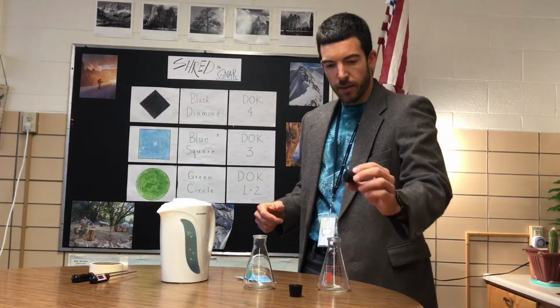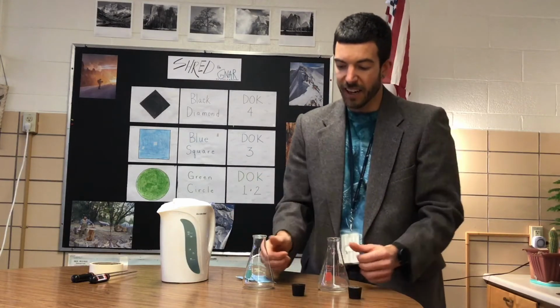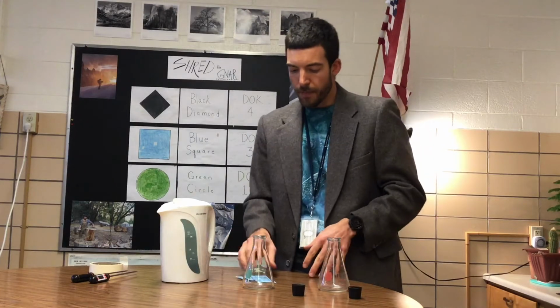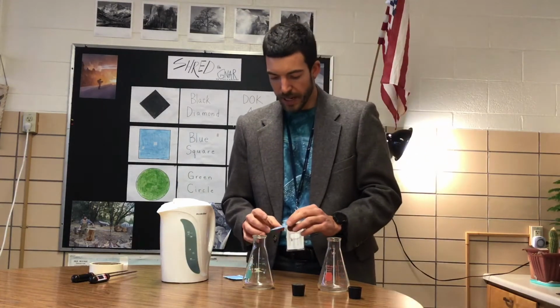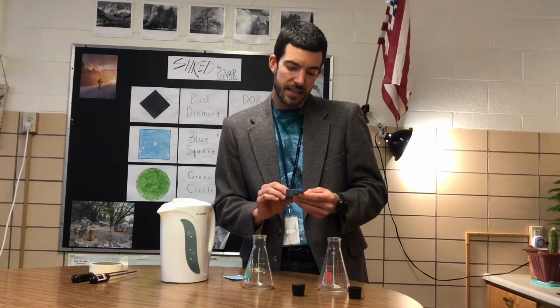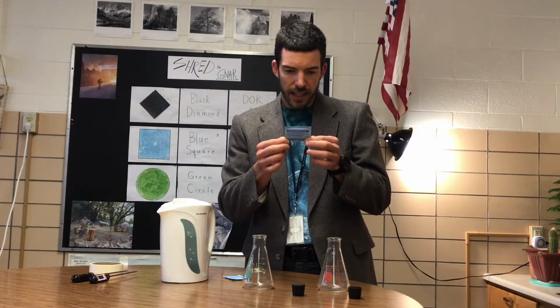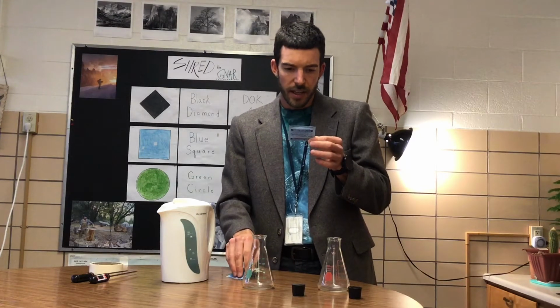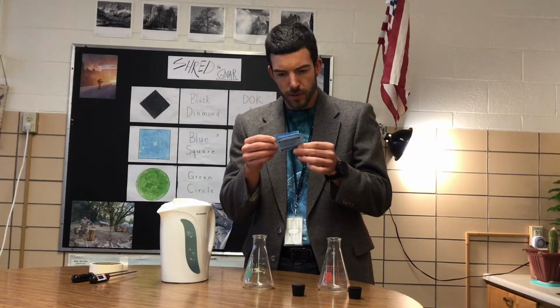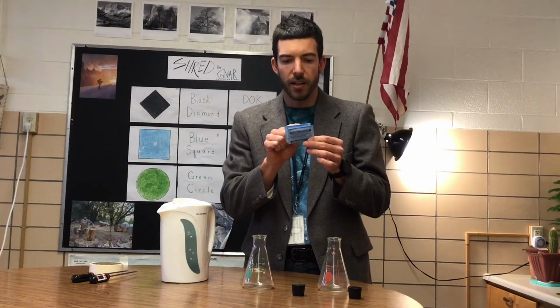So I've got two stoppers here which fit on the top of these beakers, so the air cannot really get out. If we put CO2 in, we don't want it to escape. In order to insert the carbon dioxide, I've got some effervescent antacid pain relief tablets. Now, if I look at the actual ingredients of these tablets, well, what does it say? Oh, here it is. It includes sodium bicarbonate.